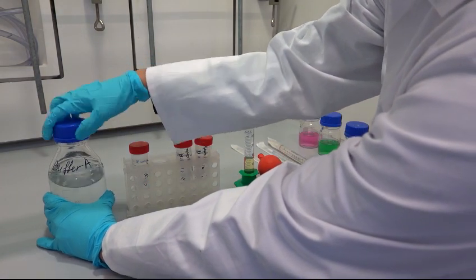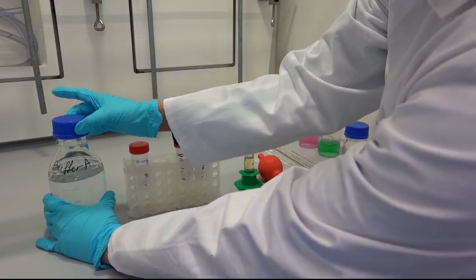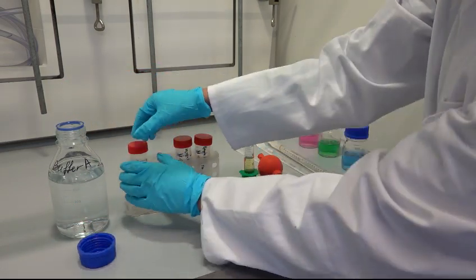In both tubes, add 25 ml of buffer A with the help of a serological pipette.